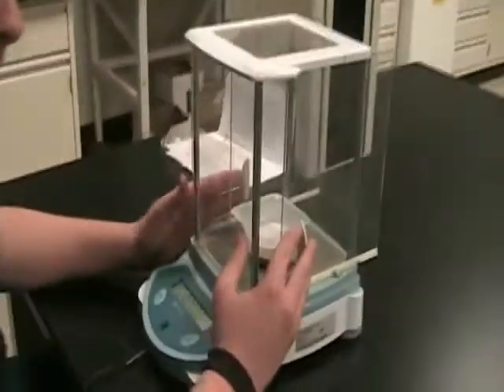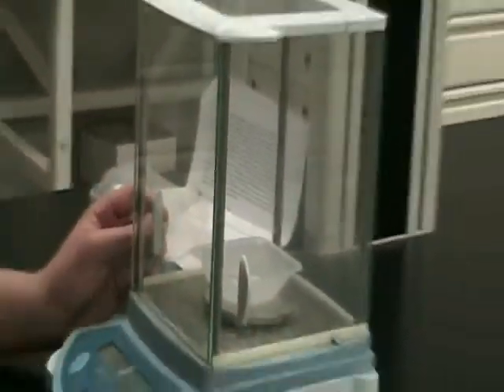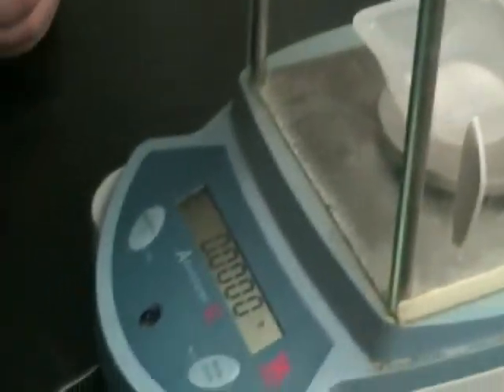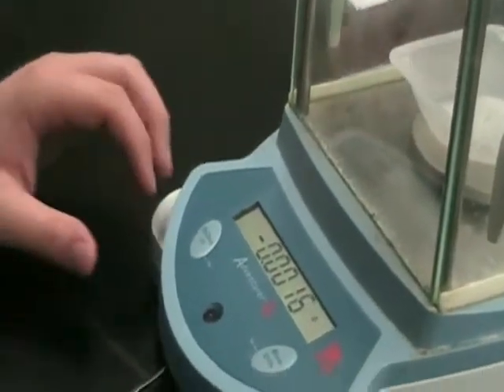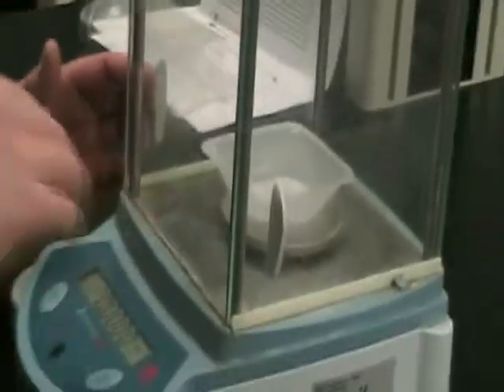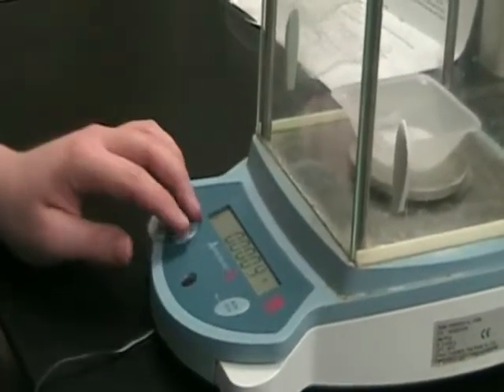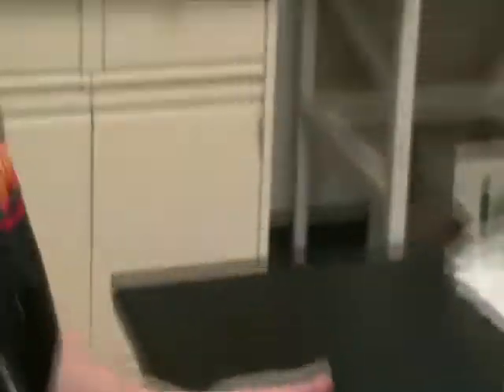Before the recap, make sure your doors are always closed, because any slight breeze with the doors open will affect your measurement. As you can see, if I create a little air movement, you'll see the numbers change. Breeze is a major factor when measuring. Now that I've disrupted the calibration, we're going to have to zero it out again. That's why it's necessary that all doors are always closed so no breeze ruins the balance. Make sure you are very steady with this.